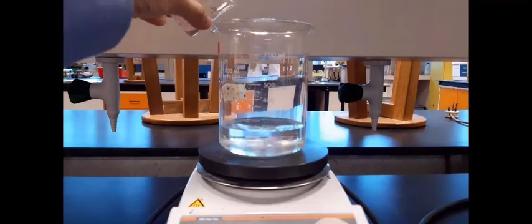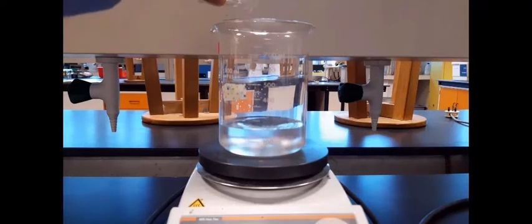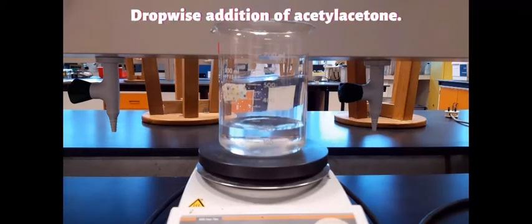What is stirring right now in front of you is 10 gram of sodium acetate in water, and we're going to pour in a solution of manganese chloride tetrahydrate. Let the mixture stir, and after that we'll add 18.8 ml of acetylacetone. We're going to use a dropper to add this really slowly into the mixture. All the acetylacetone has been completely added, and the mixture is currently stirring.